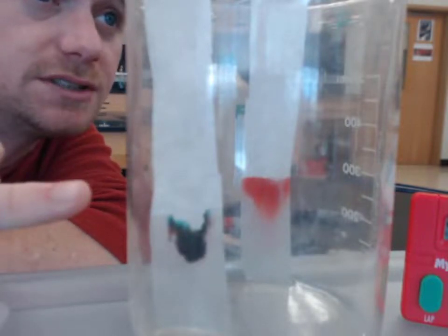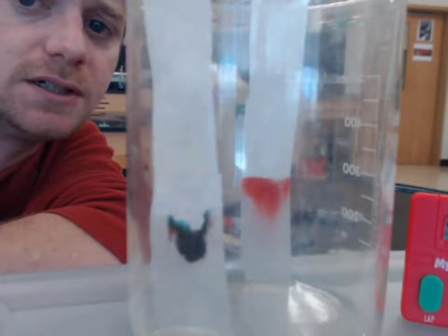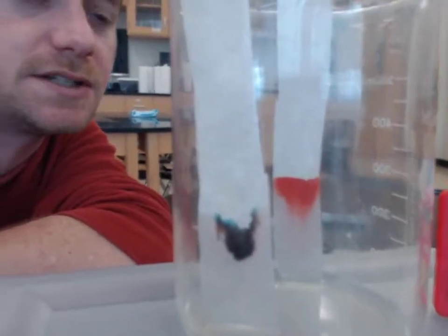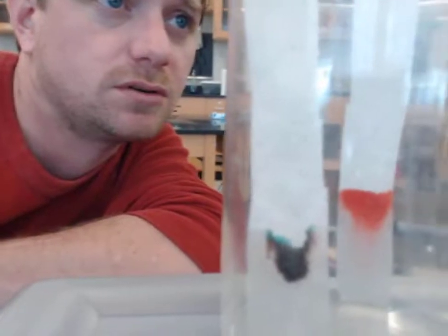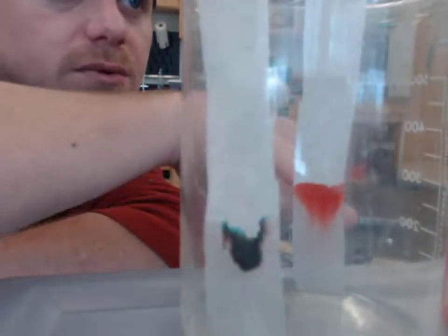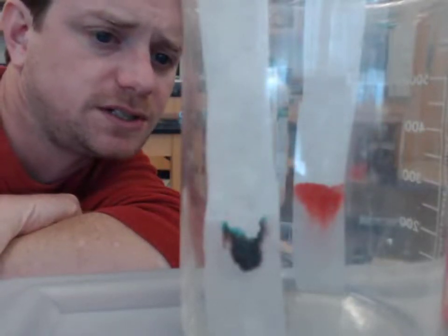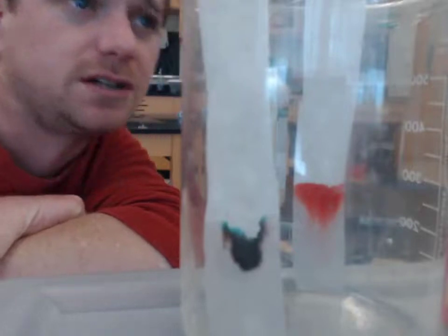However, you can definitely see these different colors in the black ink, as if it's made up of more things and different things compared to our red blob on this side, which it's hard to tell that it's even made up of anything other than just red, actually.